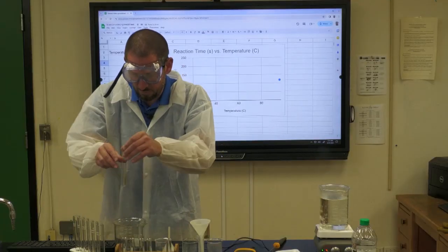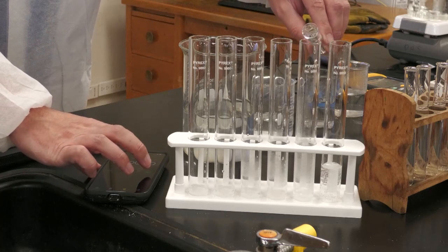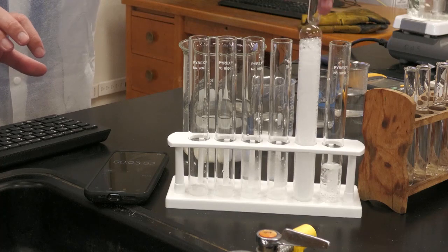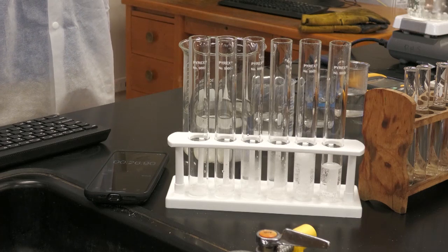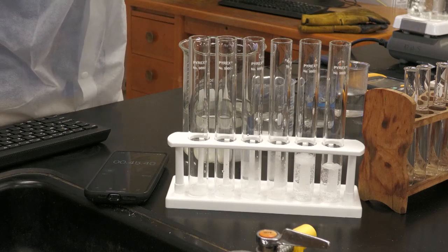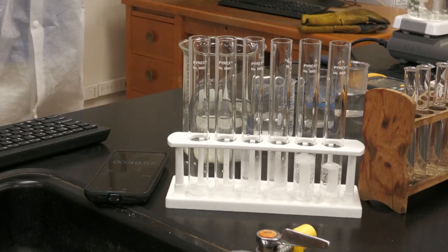All right, we're going to reset and do the same thing for the second one. Here we go, 1, 2, 3. I'm not sure how this is coming up in the video, but you can still clearly hear a lot of the bubbles popping.